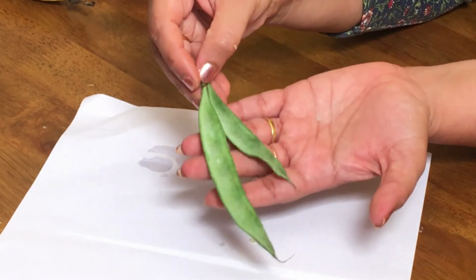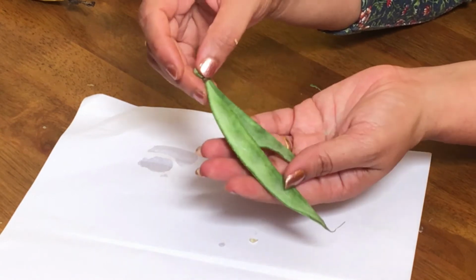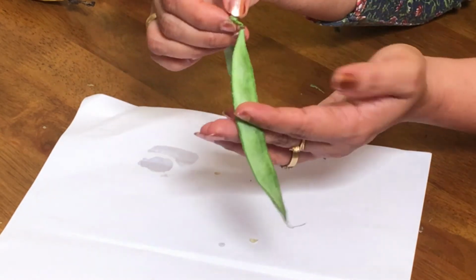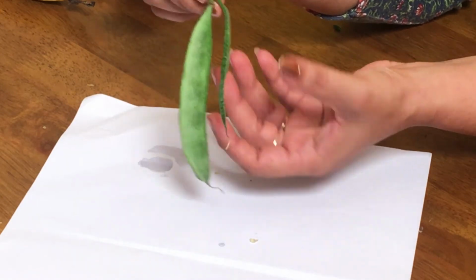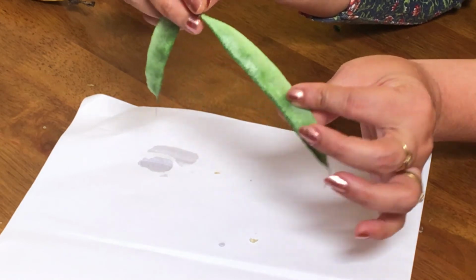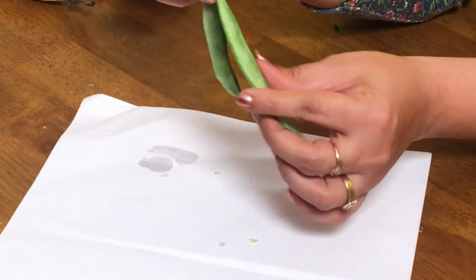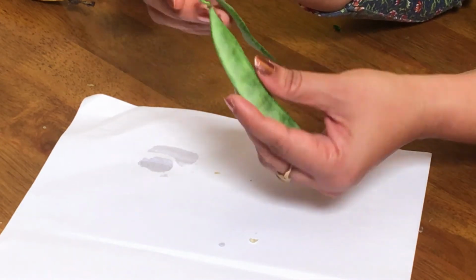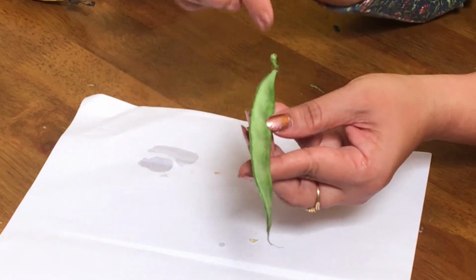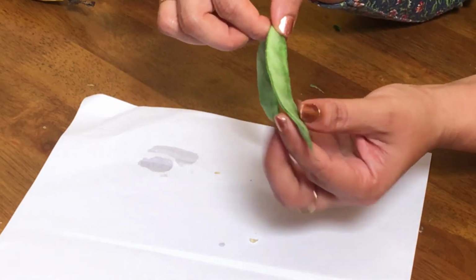Double beans. This is a legume, which is again a simple fruit. This was an inflorescence, so there were two flowers here. Each flower had a carpel, and the carpel has developed into a fruit. This will not become colorful, it will be green in color, and this type of fruit is called a legume. You will be able to see marginal placentation, and seeds will be arranged inside.